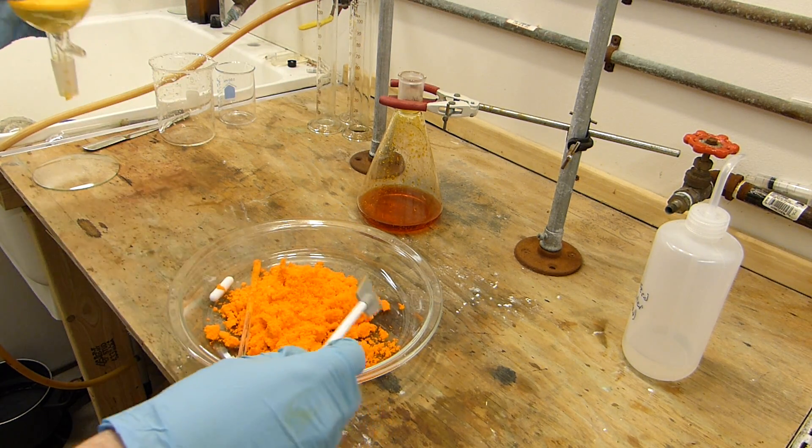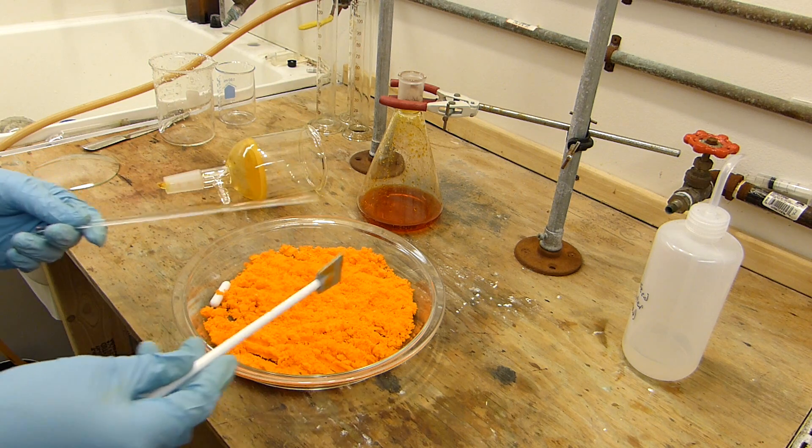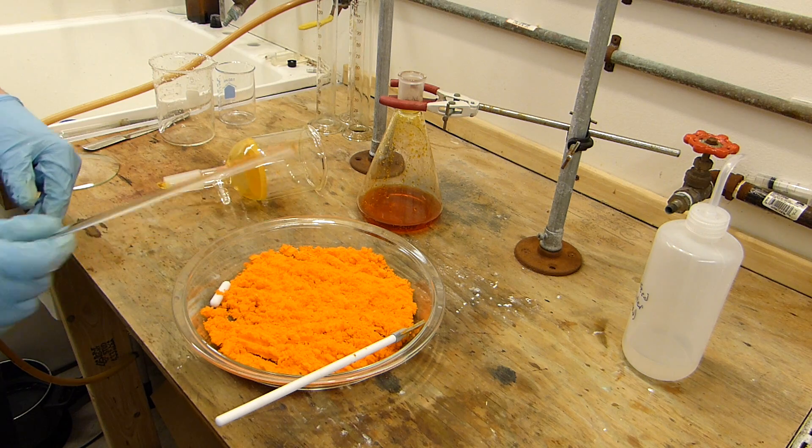Nice and clean. All right I've just finished spreading this out so now the last thing is just to get this on a water bath and dry it nice and slowly until we have our pure dry product.